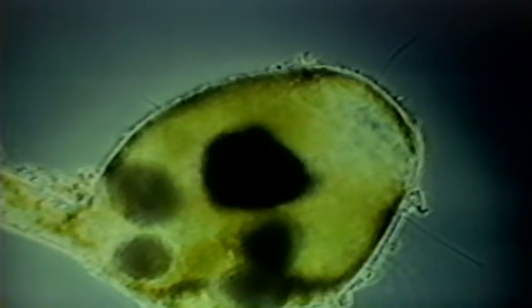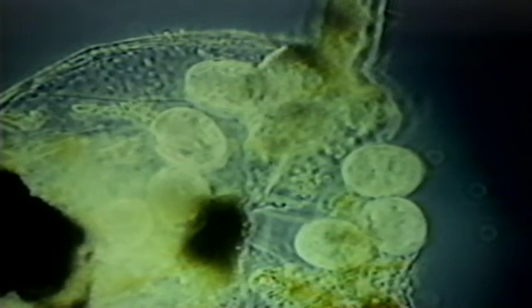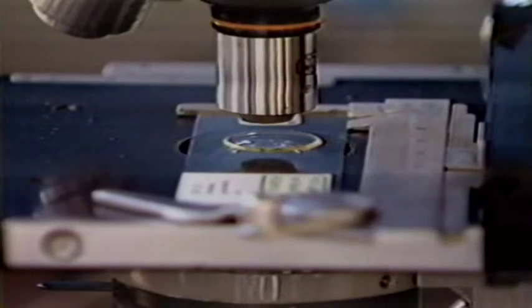A high magnification is needed in certain situations, and a lower magnification may be called for in others. Most objective lenses are matched so that the image will remain focused when the nose piece is rotated to bring another lens into place. Such lenses are said to be parfocal. Here we can see what happens to the image of the cells of an onion root as the magnification is increased from 100 to 400 times by rotating the nose piece.